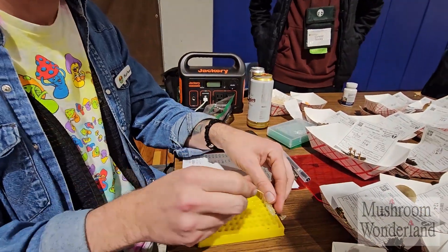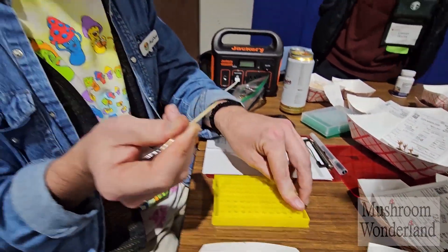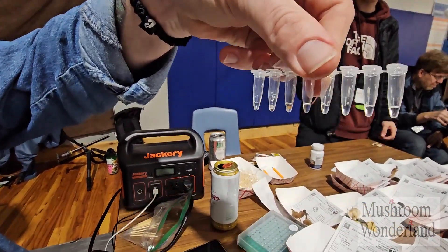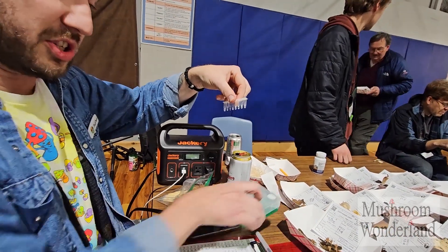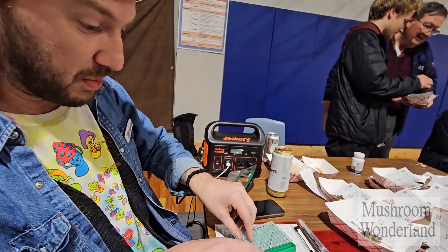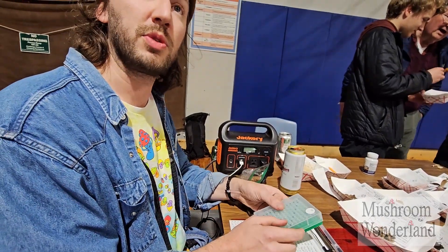For nanopore, you really don't want actual physical tissue in the tubes. This is the extraction buffer — it's going to start lysing DNA out of the sample. Just a few seconds of the swipe in there; there's a liquid in the tube. It's pulling the DNA out into solution, and then that will end up being the PCR product after it gets run through the thermocycler with some other reagents.